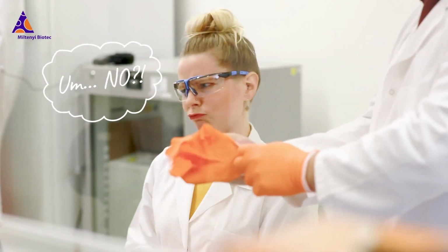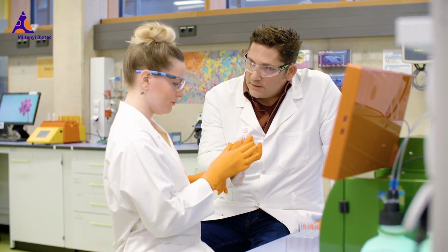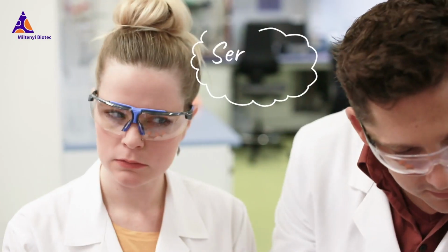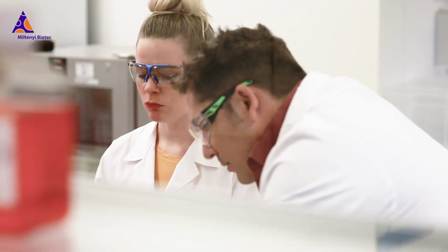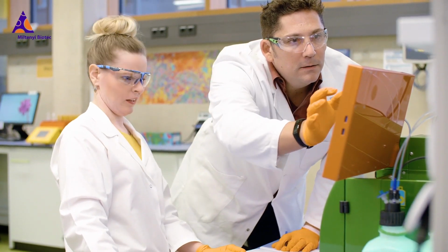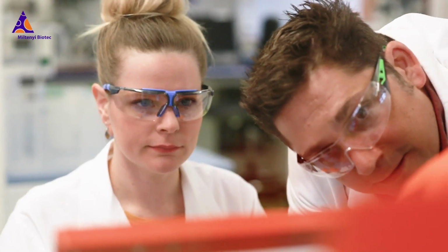So, okay, you need to have, let's see, one drop of this to go in every single one. Right. Okay. Hang on, maybe I better do it, actually. Sometimes, if you're not careful, you can put two drops in there, and then that's no good. Four, three. Okay. Get that one off. Whoa, careful. Now we're good.